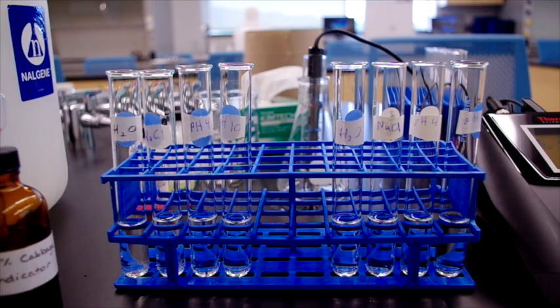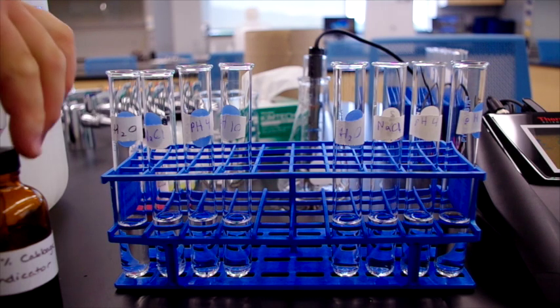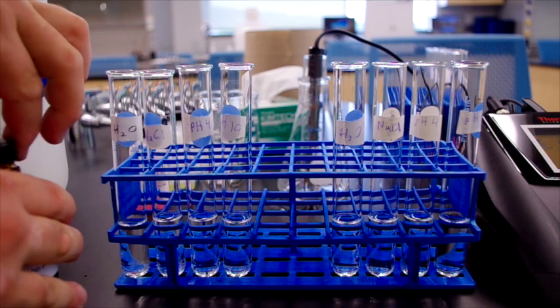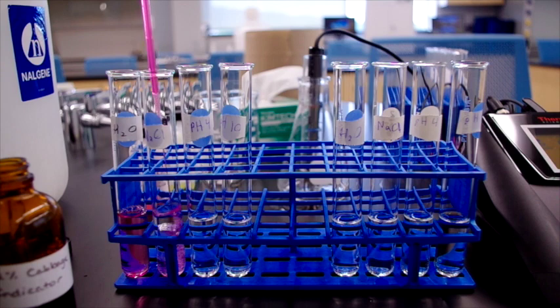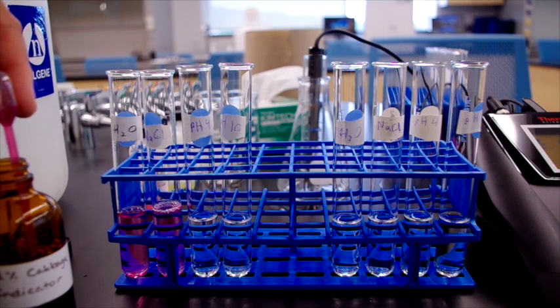Okay, so in part C of the acids, bases, pH, and buffers lab, we're going to be testing the effect of the addition of acid and base on the pH of a number of solutions. We have out here 2 copies each of water, sodium chloride, and a low and high pH buffer solution, to which we're going to add 2 milliliters of the cabbage indicator solution, like so, as we did in part 1, where we've established that this indicator does in fact work.